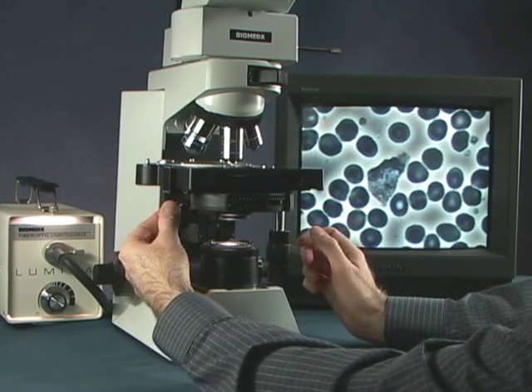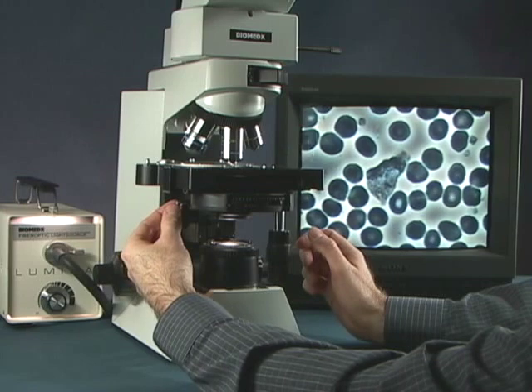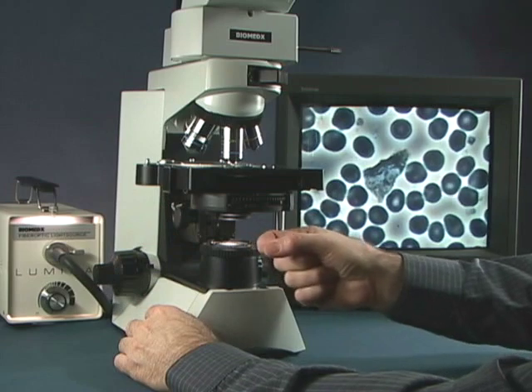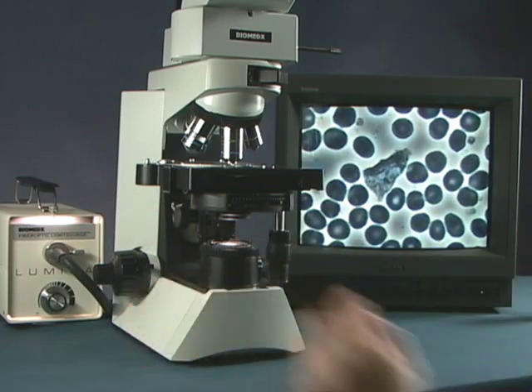So when we press this in, we actually engage a screw and turning it one way or the other, we'll move the ring down here. Let's take a look at that.